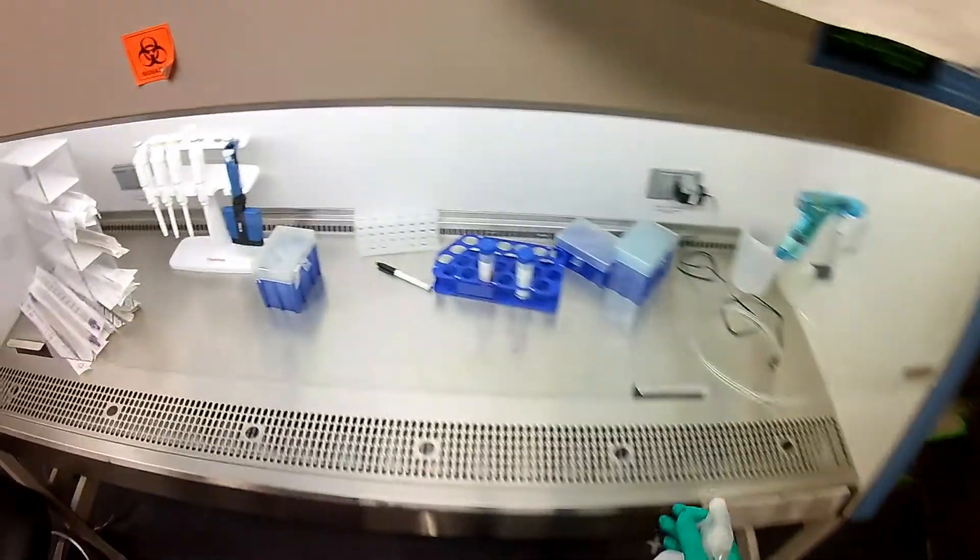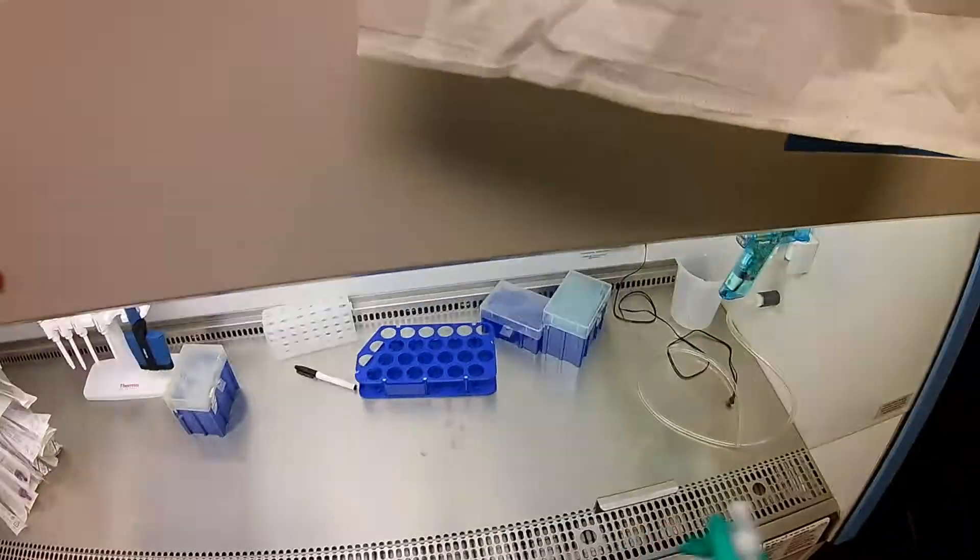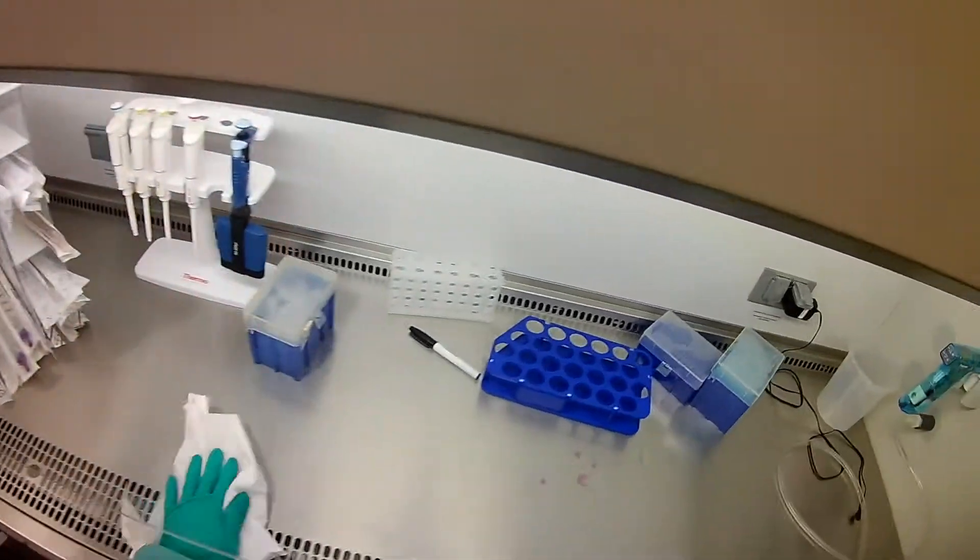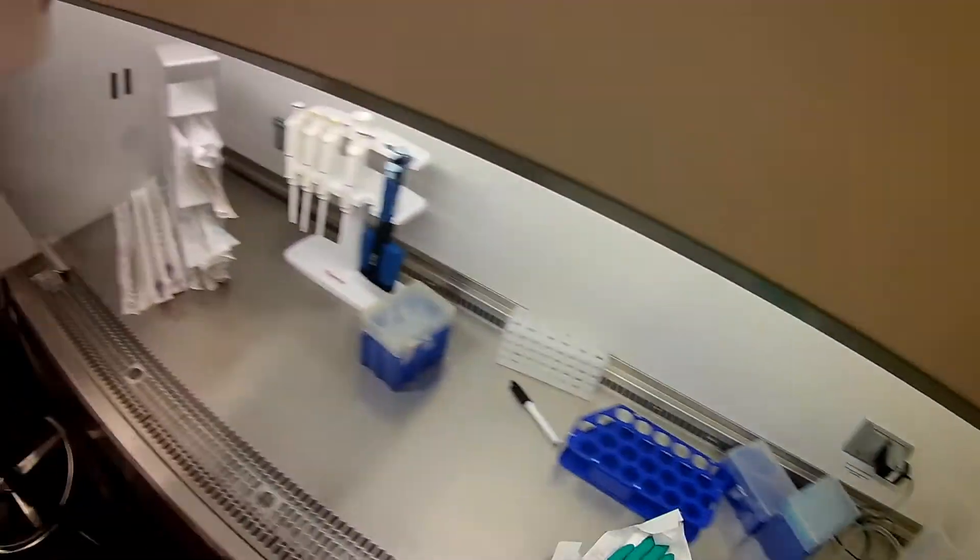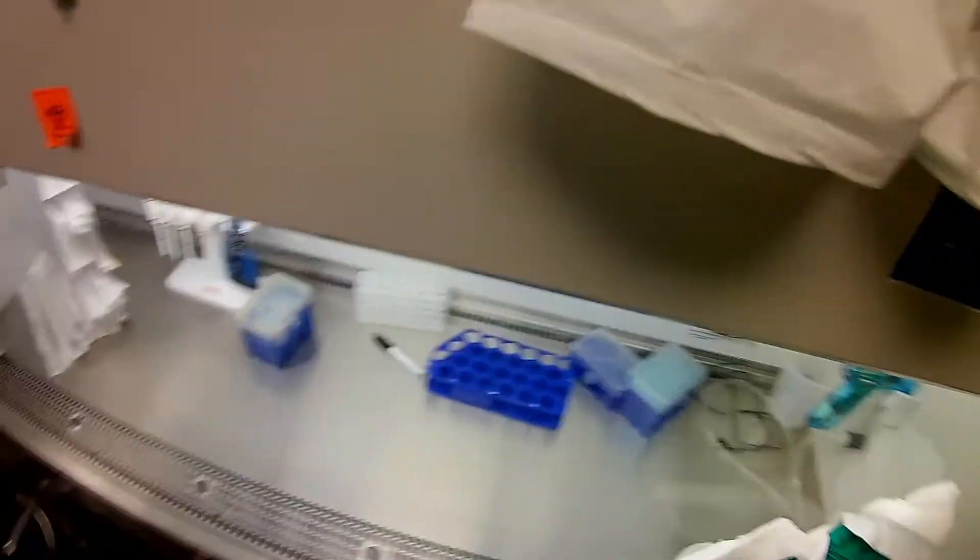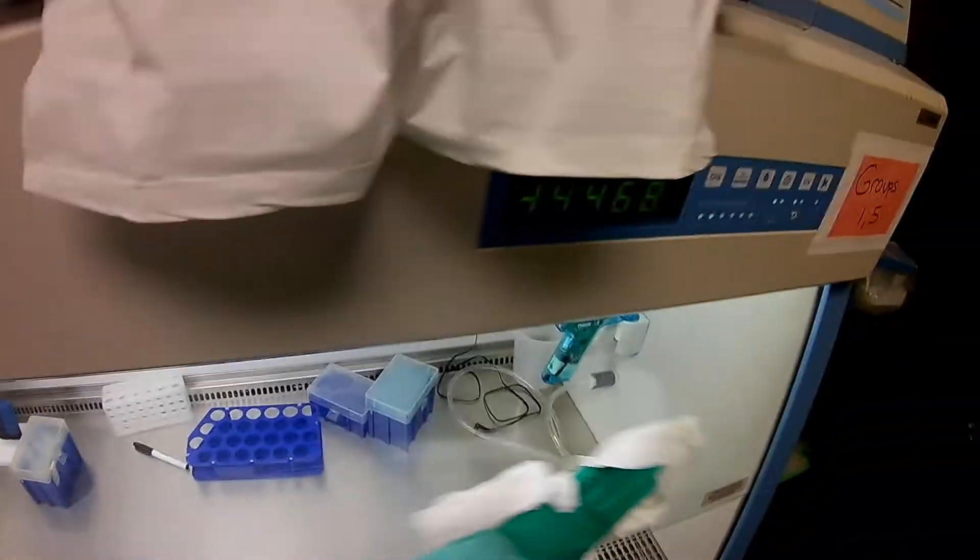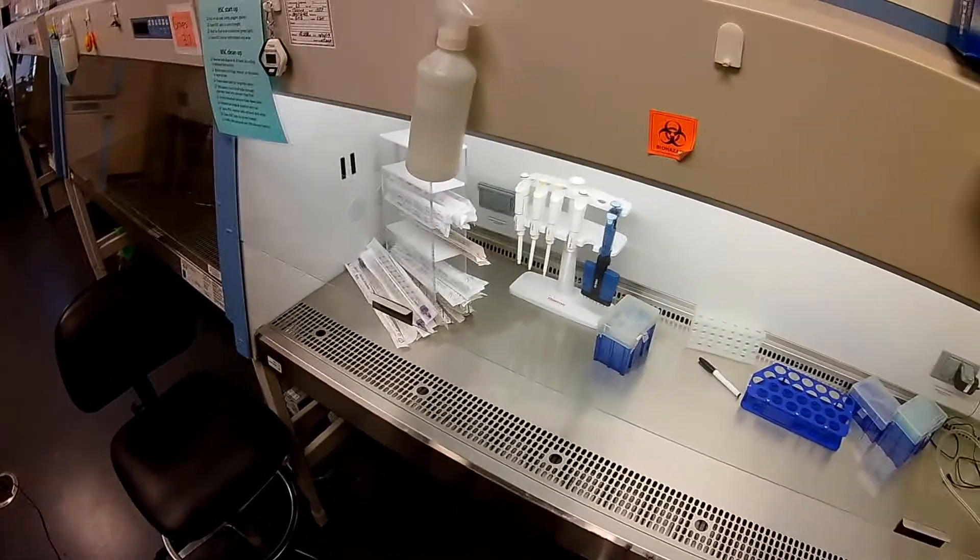Spray it down, and we're going to spray all the surfaces here and make sure I get my media and my PBS out. Spray surfaces down, wipe it off nicely. It's not to wipe dry, it's to make sure ethanol gets everywhere. I'm going to spray the front, because I was breathing on the front and we don't want to transmit pathogens from my breath or just any general nastiness.